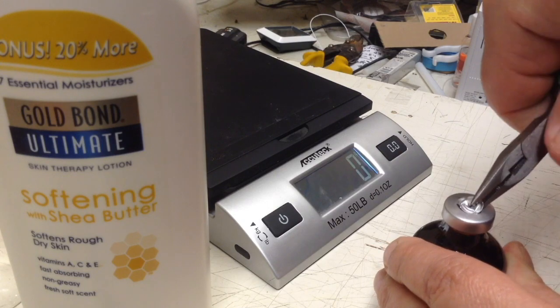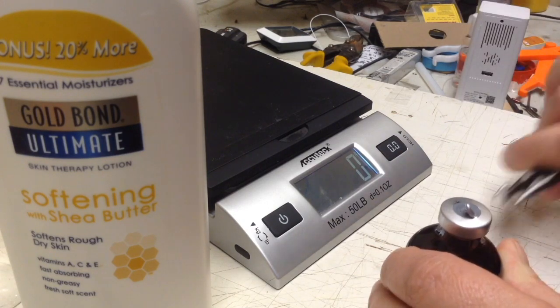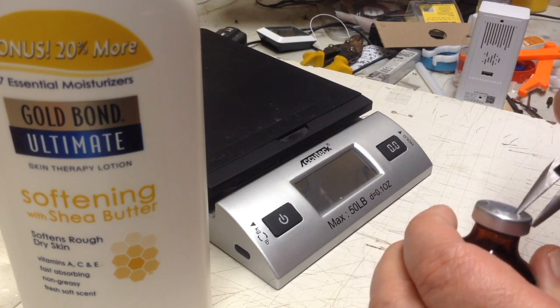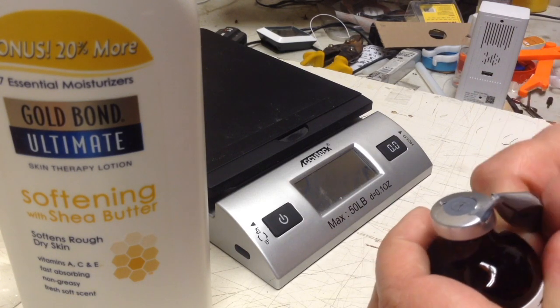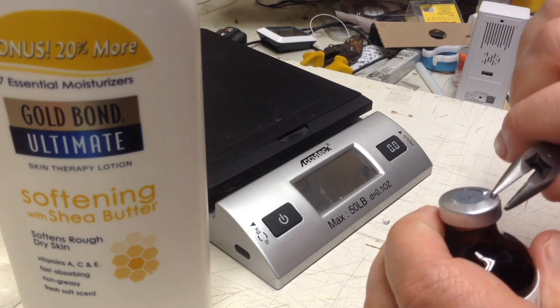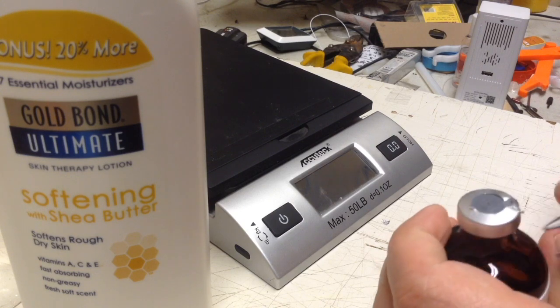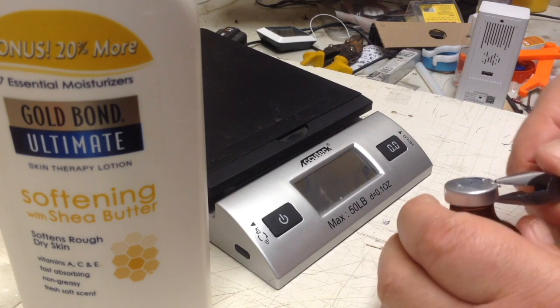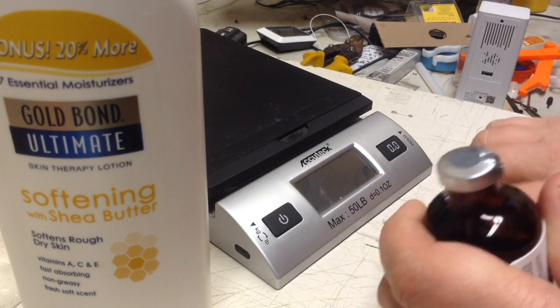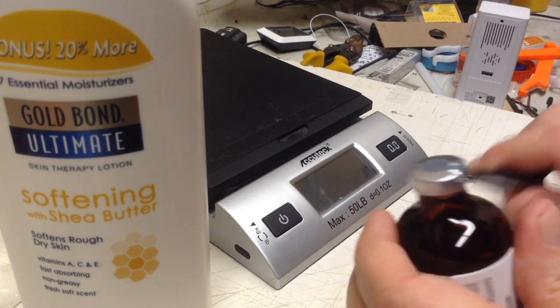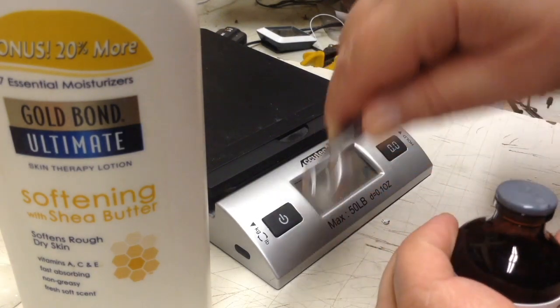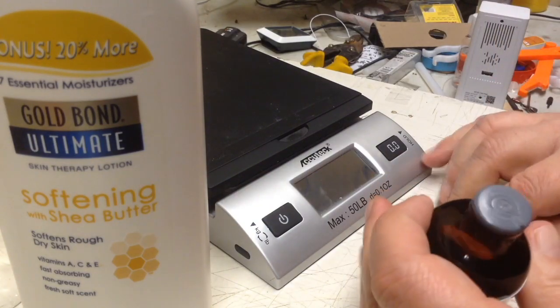Let's see here. Nobody's doing me any favors here. I'm just prying off this aluminum seal. There we go. I just used the pliers to kind of break through it. And presto.